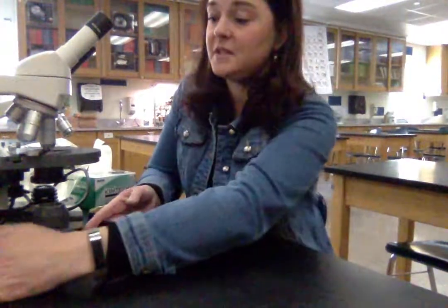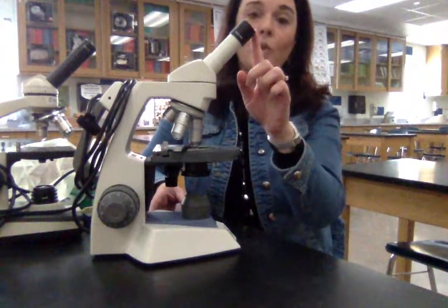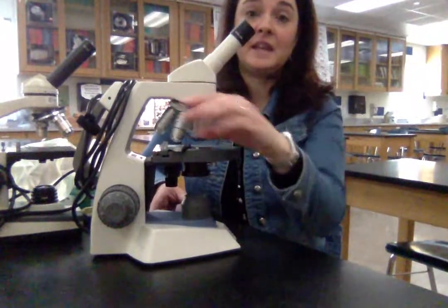I actually have a couple different microscopes here with me at the desk — one of the older microscopes we've had in the school for quite a while, and one of the newer ones we just got in the last couple years. Both are examples of compound light microscopes. The reason they're considered compound is because they have two lenses: one in the eyepiece and one in the objective, and each objective has its own lens.